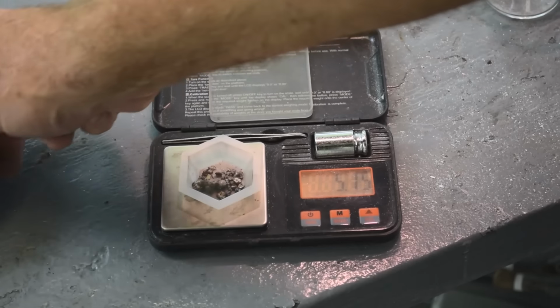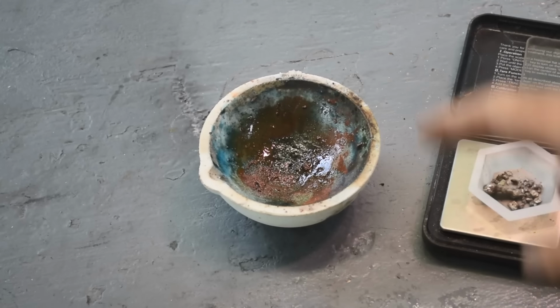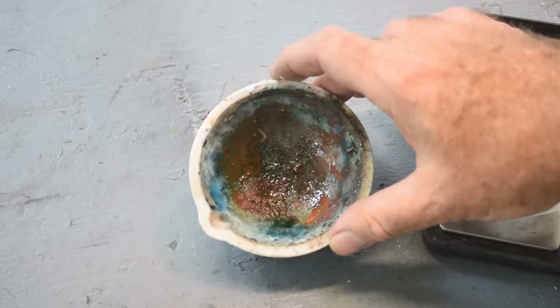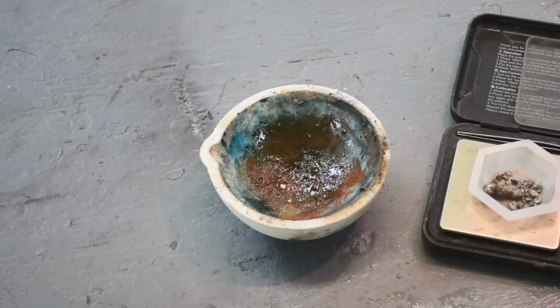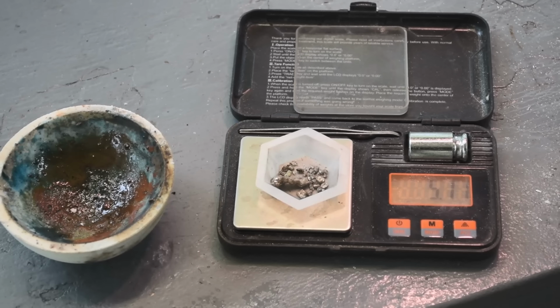And I'm sure there's still some palladium stuck in here, both as little beads and chemically bonded. I'm sure that blue color is in the palladium probably, and that red color. Probably. And there were some losses all along the way. So we didn't get nearly as much palladium out of this as I was expecting. I was expecting about 4 times as much as what I got here.